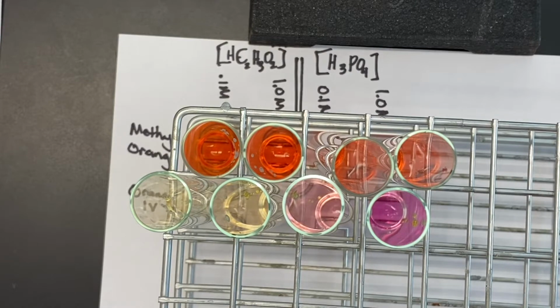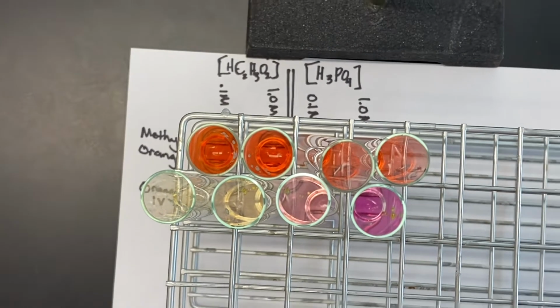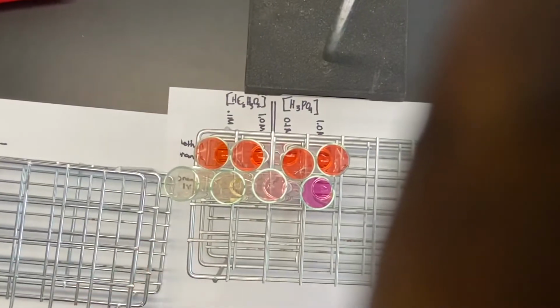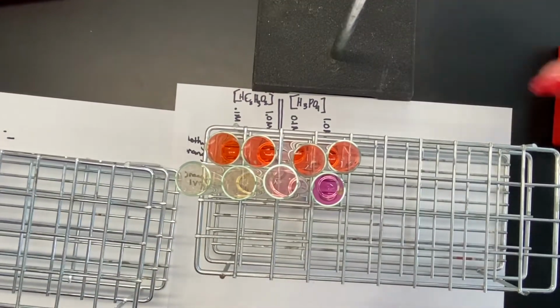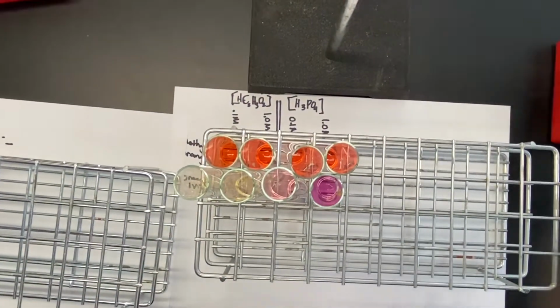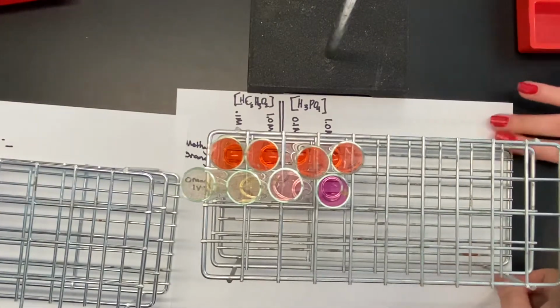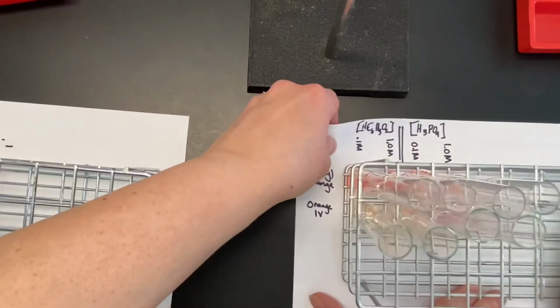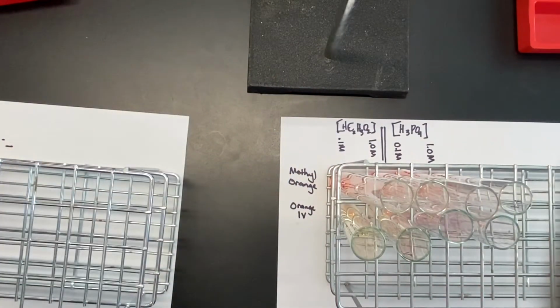So we're going to have to pull back a little bit. We could zoom out. Yeah. Oh, okay. And then here, if we like, we can move this. Did you, are we still going or did you stop? Yeah. We're still going? Okay. We could stop it. Let's stop and we'll stop it and get it set up.